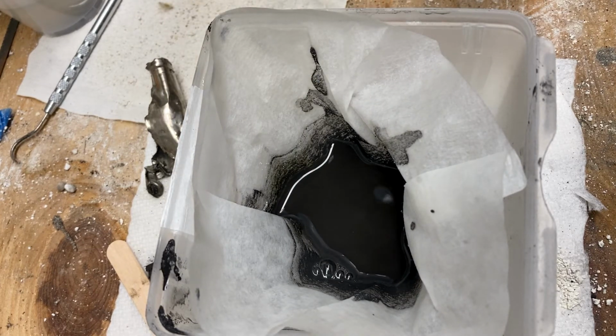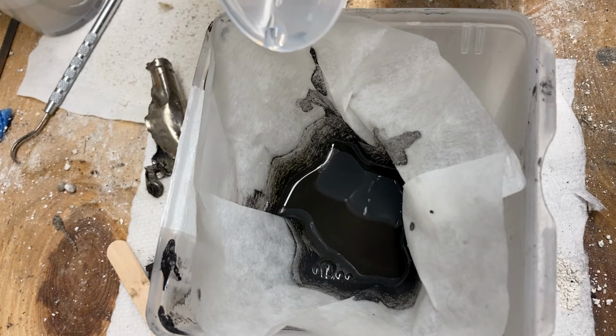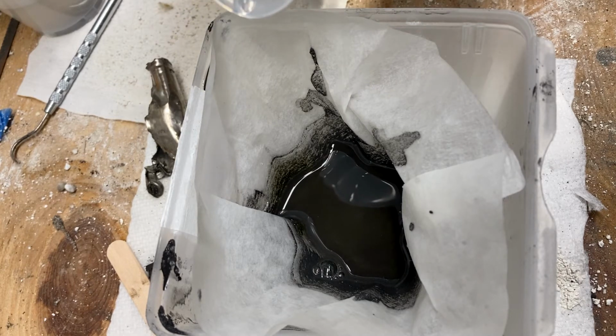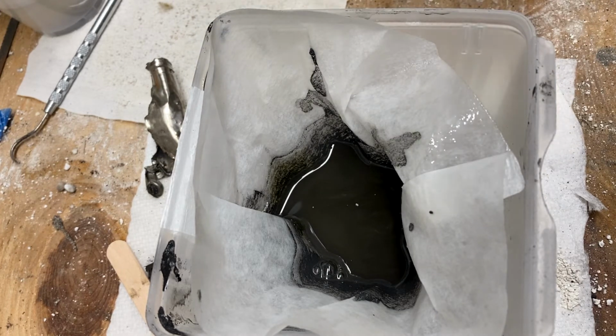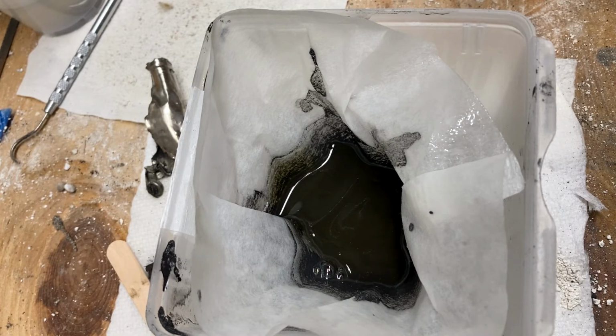And if we see any bubbling, that's going to be an indication that there was some zinc left over. And so that's more likely than not what's going on there. I'll pour some water up from the back side there and just let that go. I can see a color change in there, and I'm guessing that might be some indication that the zinc is starting to dissolve. I also do see some bubbles forming, and so my guess is, like I said, that's probably leftover zinc.